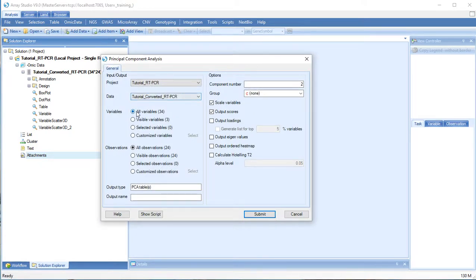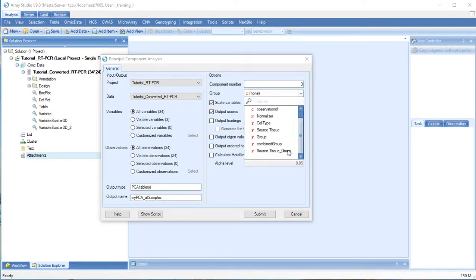Choose your input data, which variables and observations to use, and name an output. You can specify either a 2 or 3 component analysis. If you specify more, multiple plots of 2 component analyses will be shown. Let's make a 3 component analysis. Let's specify a group.